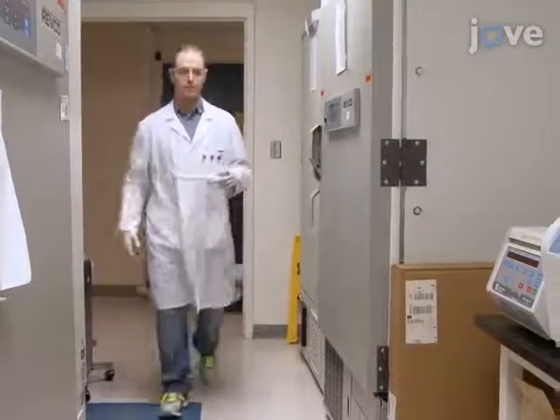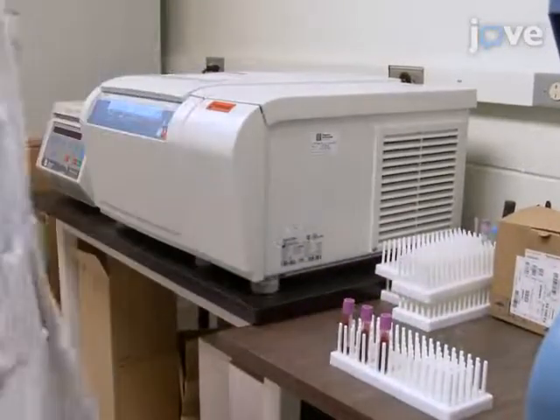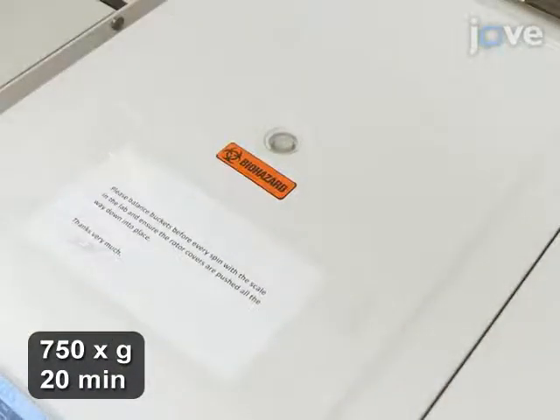In this procedure, human blood samples are collected in 3 4 milliliter EDTA K2 tubes to provide a total volume of about 12 milliliters. Centrifuge the blood samples at 750 times gravity for 20 minutes.